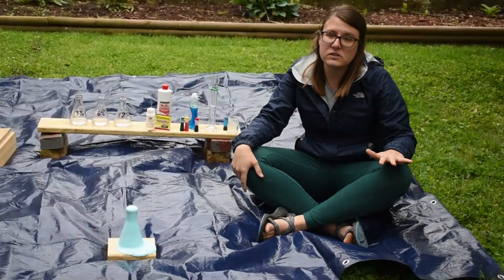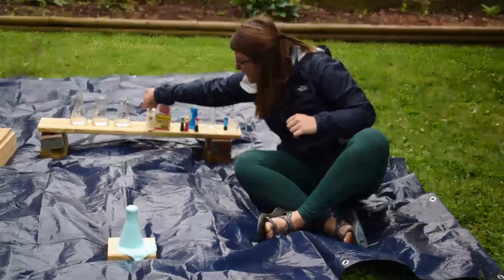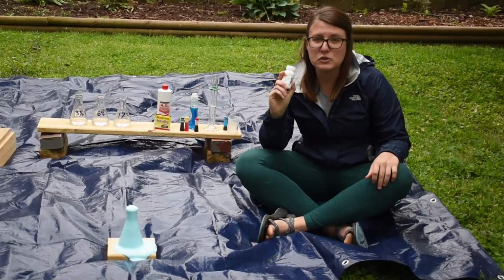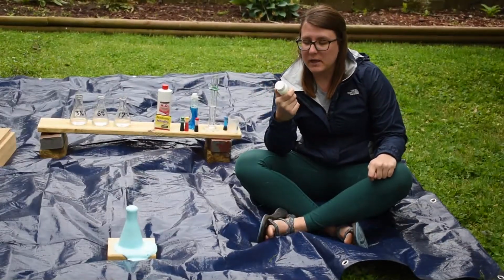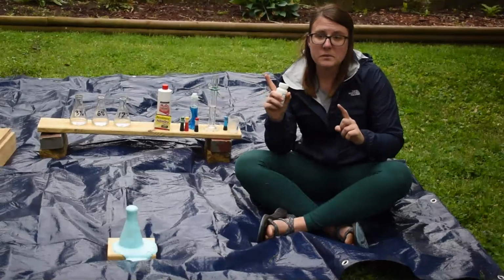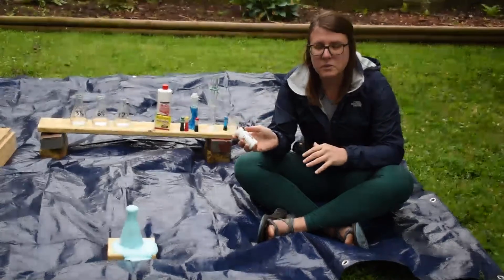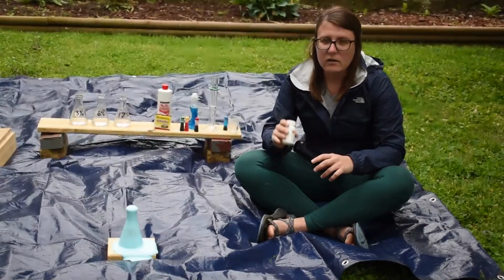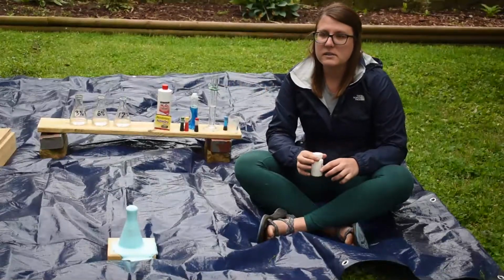So we have another 3% solution that we're going to use, but this time instead of using the yeast, I'm going to be using a chemical, a salt, which is an ionic compound. Some of my students, you guys know, we've been learning about those. So potassium iodide is what this is. Potassium iodide has one potassium and one iodine, and the potassium has given its electron to the iodine. So potassium has a +1 charge, iodine has a -1 charge. And I think you can do this with sodium iodide as well. But this guy is going to react with the hydrogen peroxide in a similar way.